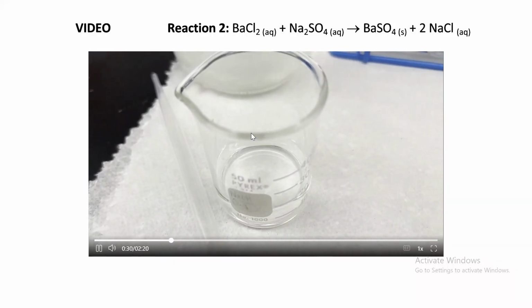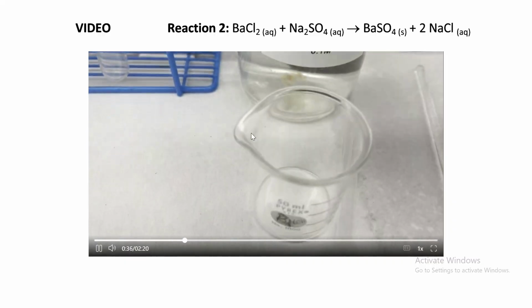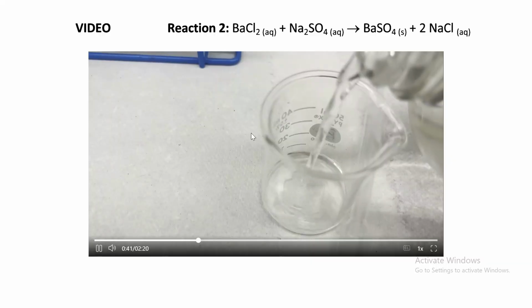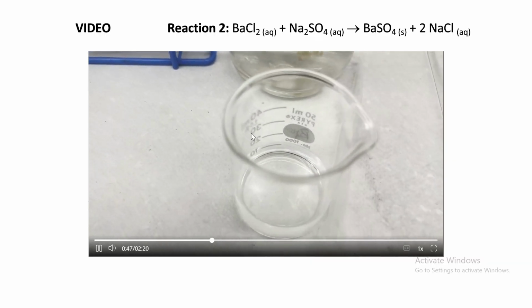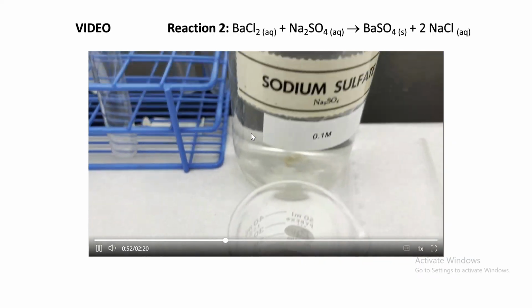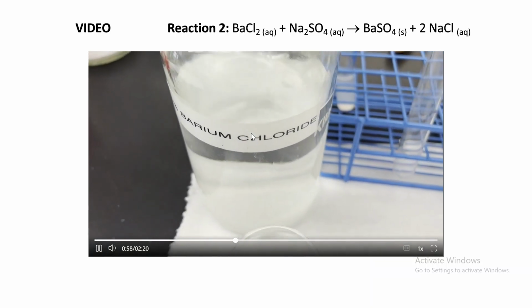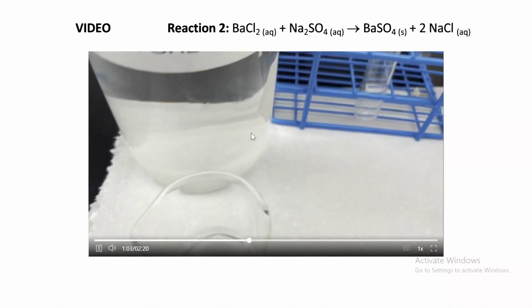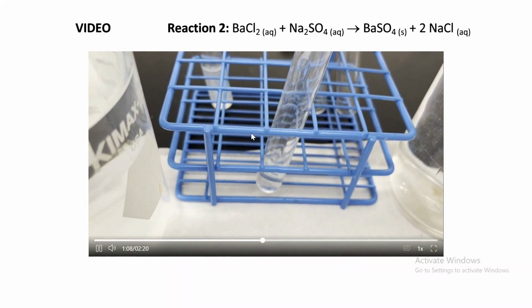Look at that. And then we have the sodium sulfate, Na2SO4. Again, it's a clear, colorless liquid. Pour a little bit. Next, what we're going to do is mix both of them. Before, clear, colorless liquid, as you can see, we're going to now use the transfer pipette. Take some of the barium chloride. And notice we put it in a beaker so we don't contaminate the original bottle. Take some barium chloride, put it in a test tube. Very nice.